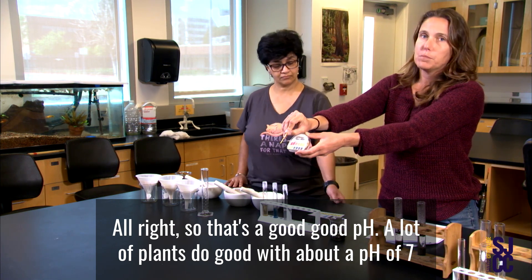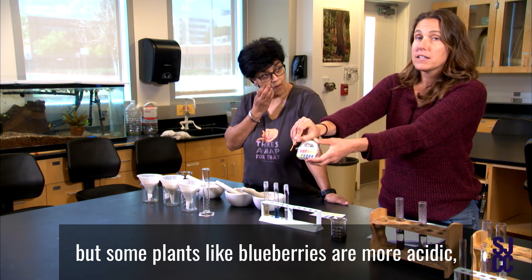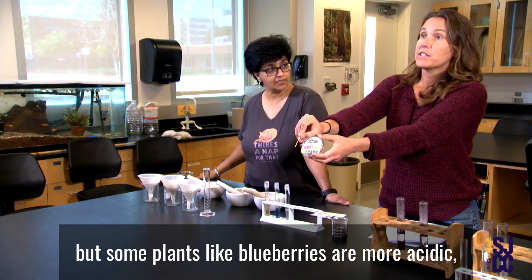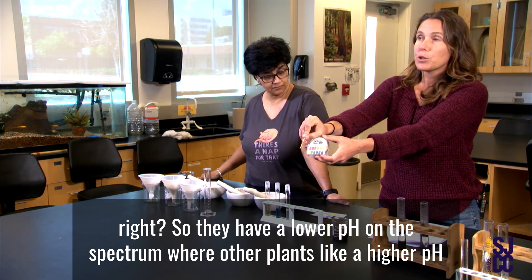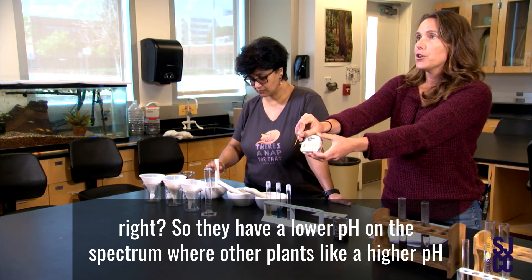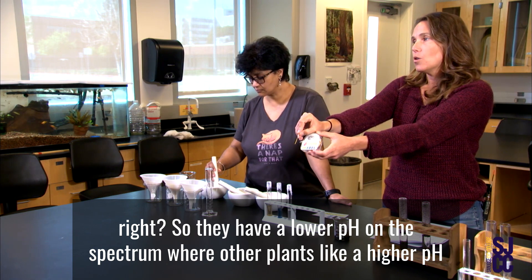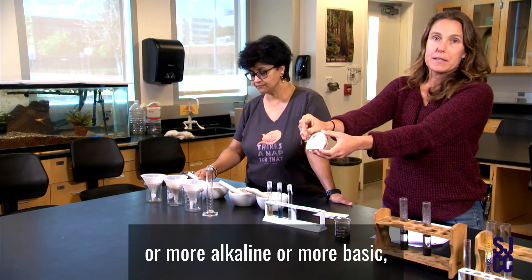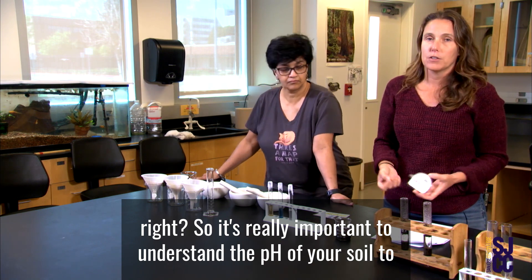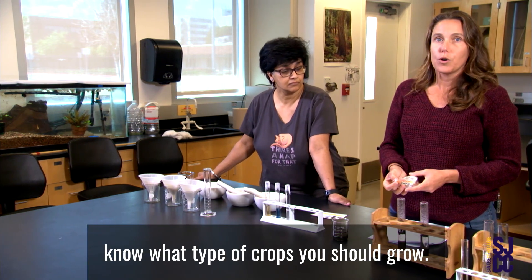That's a good pH. A lot of plants do well with about a pH of seven. But some plants like blueberries prefer more acidic conditions, so they have a lower pH on the spectrum. Other plants like a higher pH — more alkaline or basic. So it's really important to understand the pH of your soil to know what type of crops you should grow.